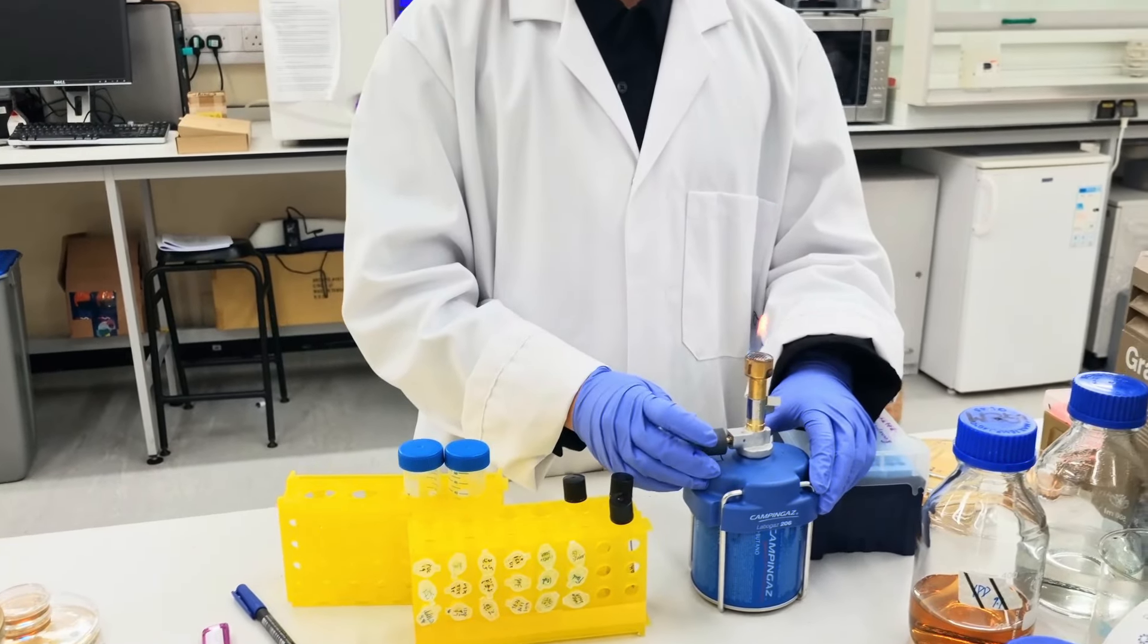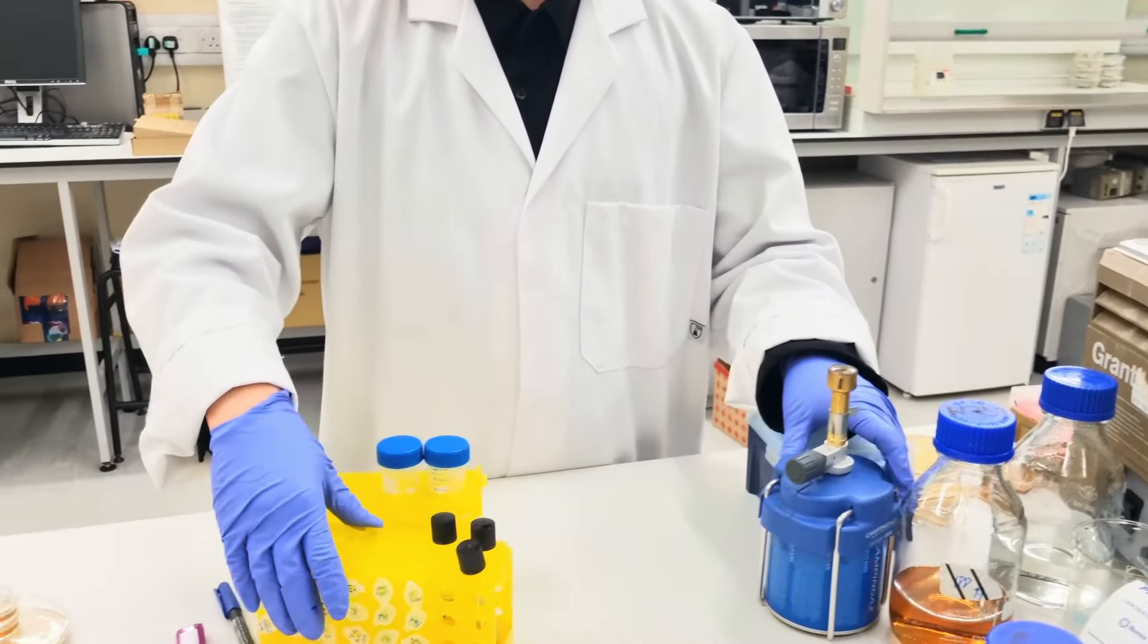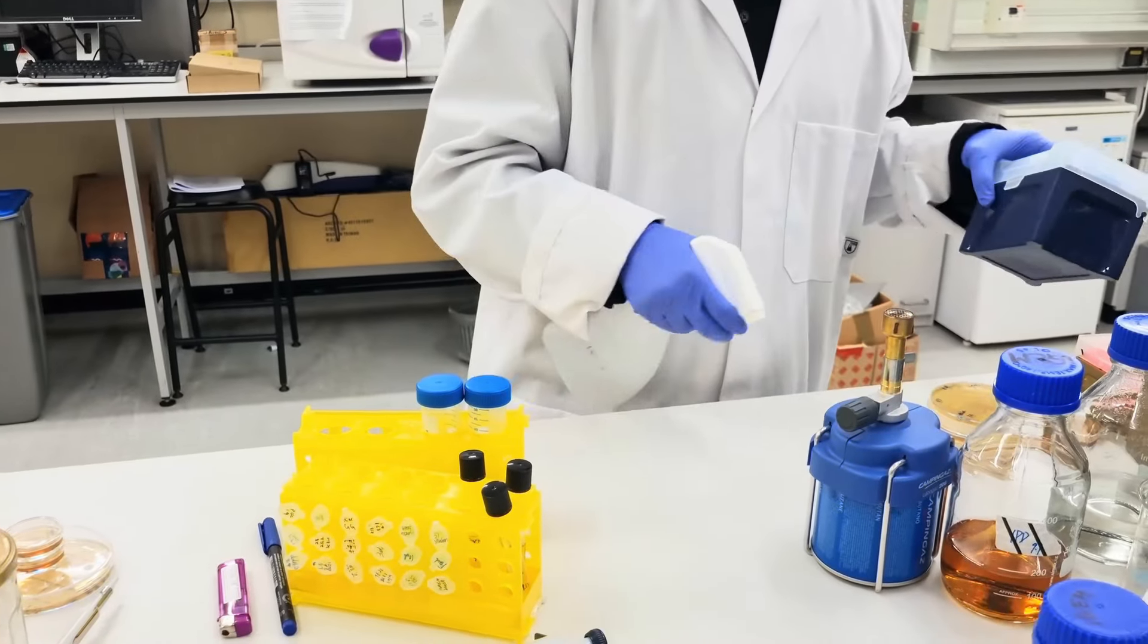After finishing your experiment, switch off the flame and clean up your bench by spraying some ethanol.